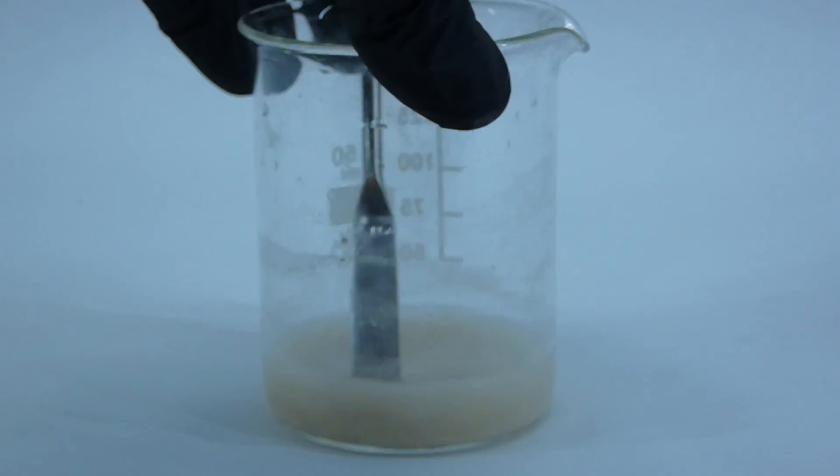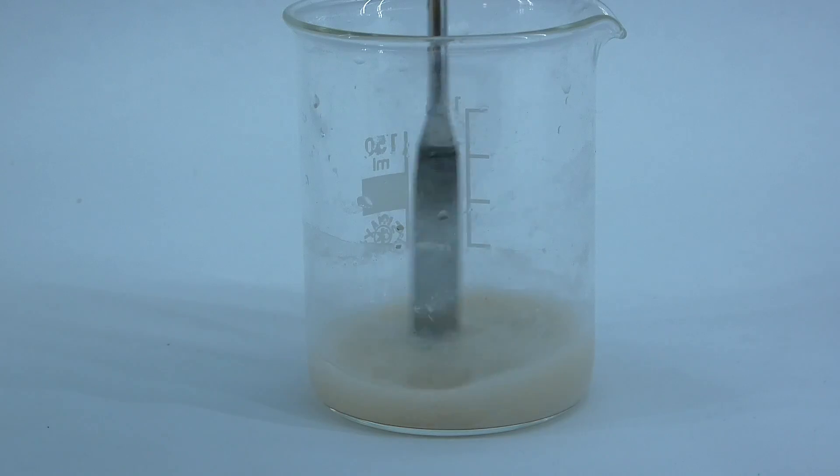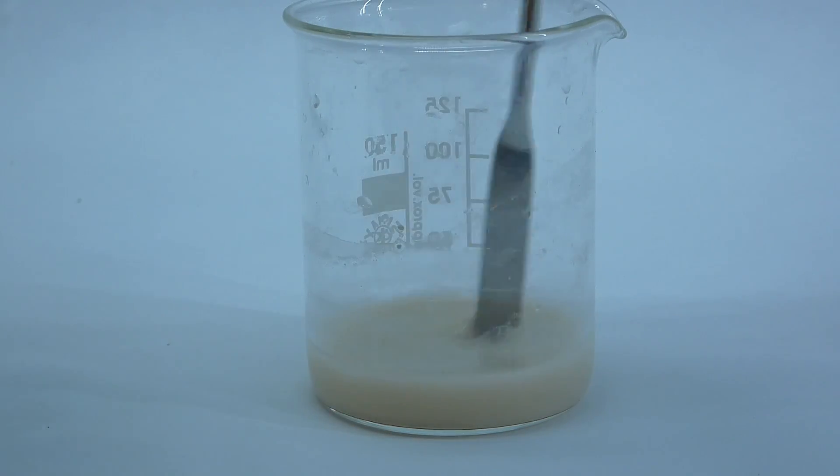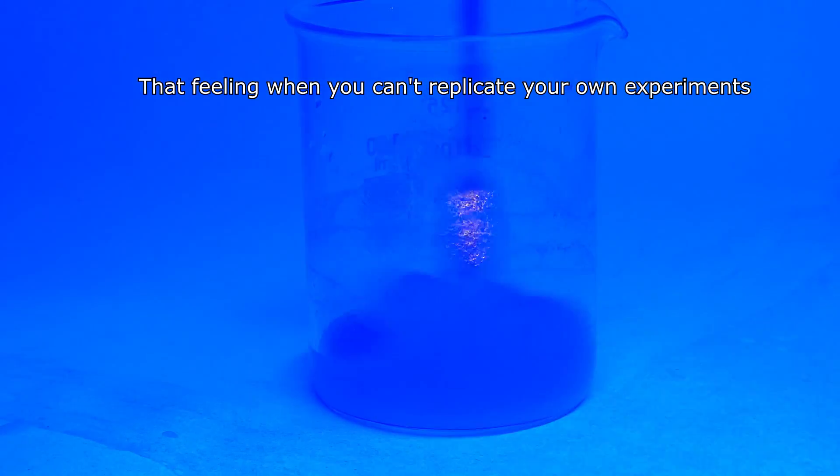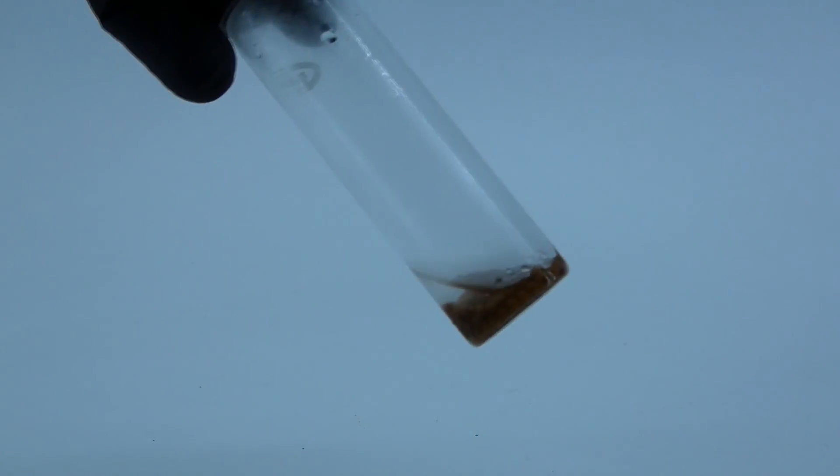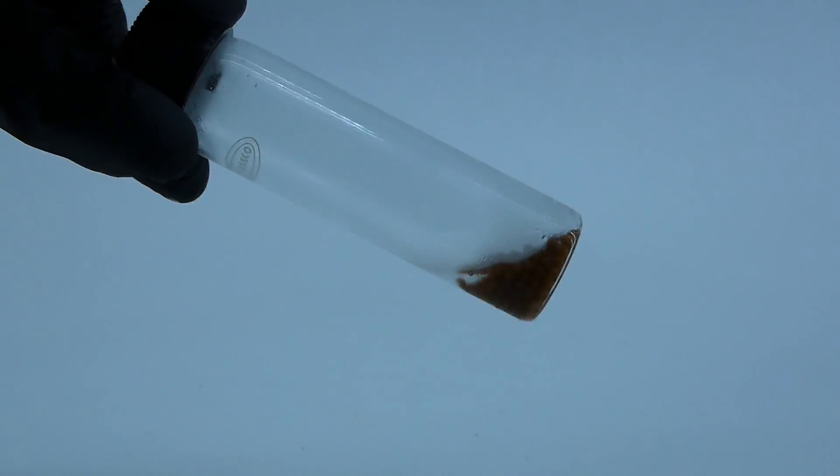After two failed experiments, I now wanted to do something that would work, so I chose to make some of the yellow complex to fill up a vial again, but for some reason when I made it, it turned into a disgusting brown sludge that didn't glow at all. I was quite sad because not only my chemistry didn't work, but I was also running low on pyridine, and I absolutely didn't want to make it from vitamin B3 again.